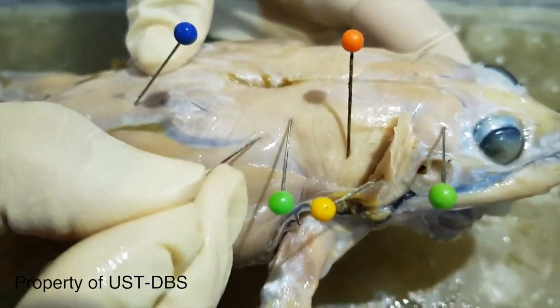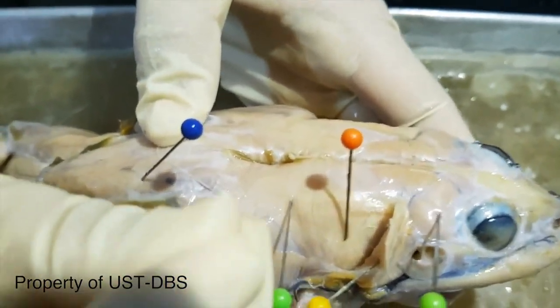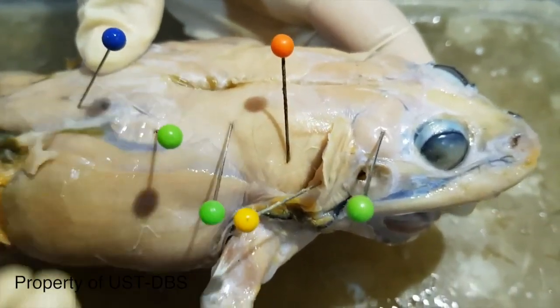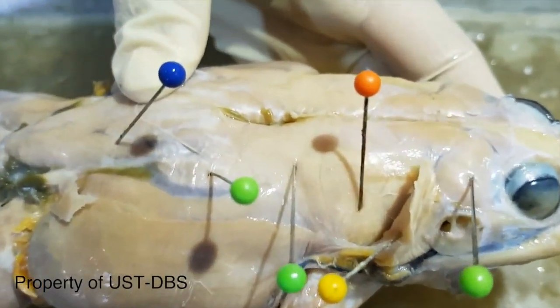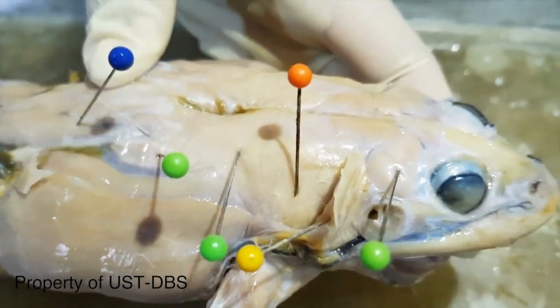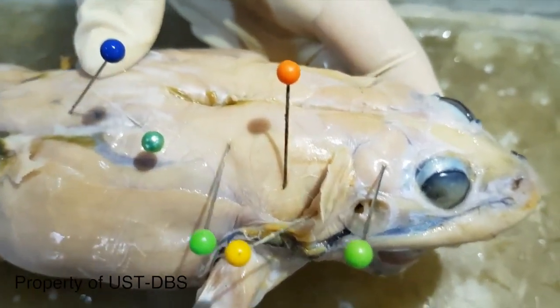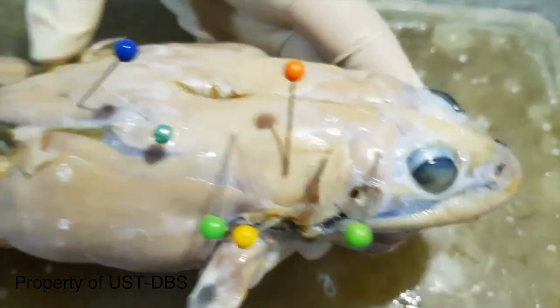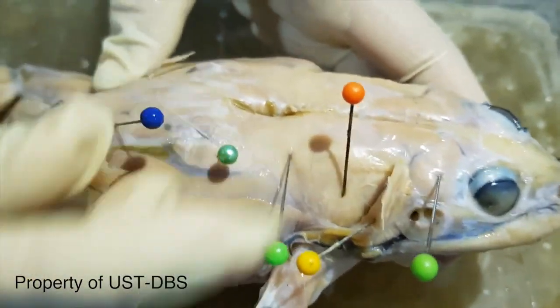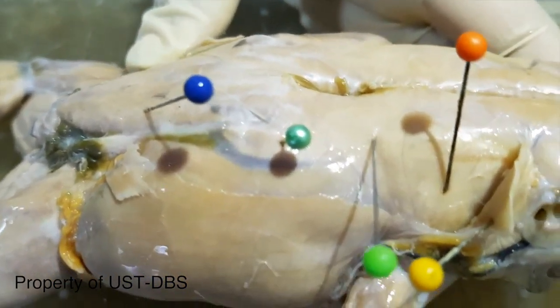This small muscle here is the iliolumbaris. I'll change it to a different color for you. So, coccygeoiliacus. And this is the gluteus muscle.